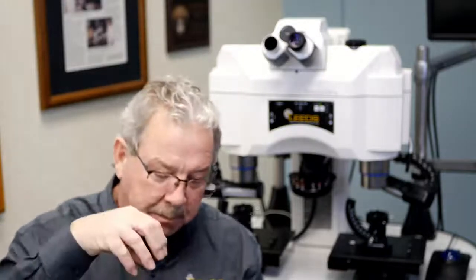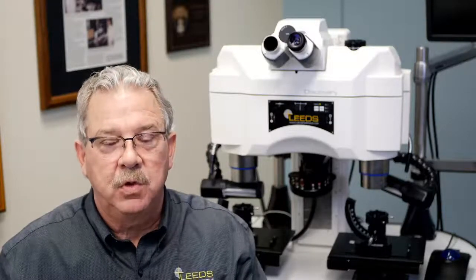Okay? So what did I just say? Well, in the old eyepieces you had to almost bury your eyeball into the eyepiece to be at the proper height and get it in focus. And if you moved your head even a little bit, typically you would tend to lose your image or start to see a black ring or whatever. That area of acceptance has also grown over the years.